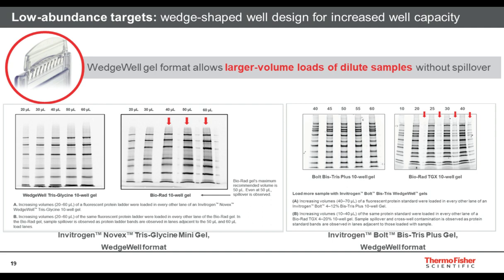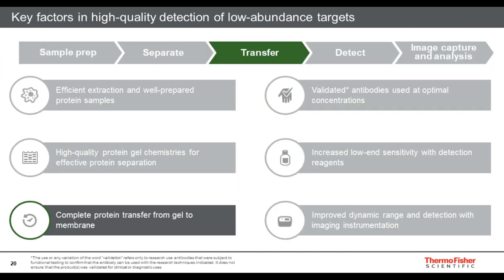In the images below, we show Tris-glycine and Bis-Tris wedge well formats compared to Bio-Rad gels. In both of these cases, we can see that loading up to 60 microliters of volume in the wedge well gel format does not have protein spillover or band smiling in the lanes compared to the non-wedge well formats. Wedge well gels are available in a variety of gel chemistries and again are ideal for loading high volumes of dilute samples in the detection of low abundant targets.